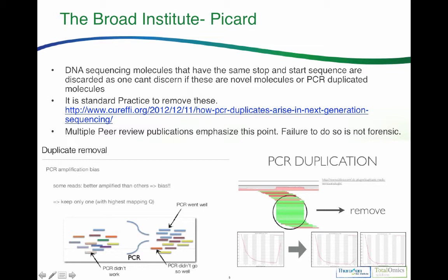However, when you get here, they all have the same start and stop. And so now you don't know if that's just PCR took off on that one particular amplicon and over-replicated it because it was selectively amplified due to its sequence context, or whether that is actually a real representation of the native genome. So it instantly removes these. In fact, this is standard in clinical sequencing: any data that looks like this, you toss it all out, because you can have Darwinian amplification, where something based on the nature of this PCR product, maybe a SNP in there or something else, makes this piece of DNA amplify faster than this one. And then bang, these take off, and you don't know if you're really sampling both alleles.